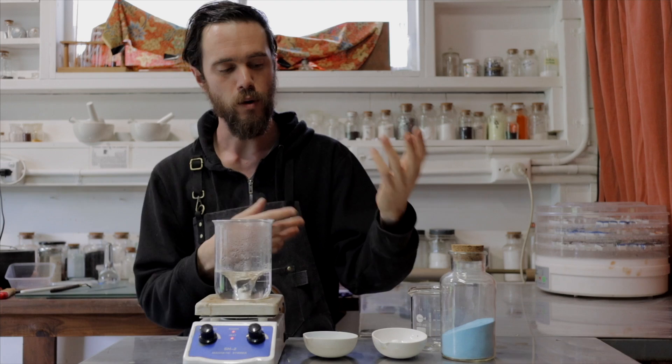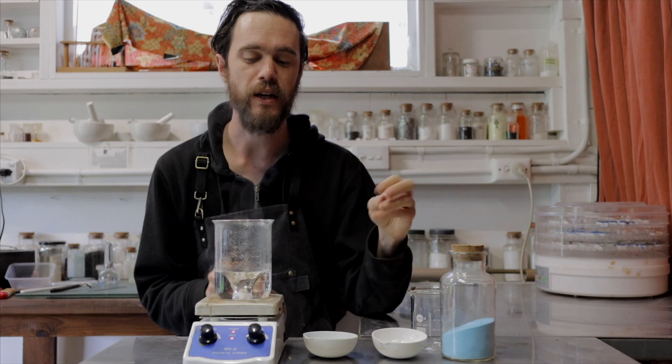Hello and welcome back to the Alchemical Arts. Today I'm going to be doing a shorter video than the last one, but it's going to be a continuation from the last one because we're still working with copper compounds. So instead of blue verditer, we're going to do green verditer this time, which is essentially synthetic malachite. If azurite is the blue copper carbonate in nature, malachite is the green version, and so what we're doing today is making the green variant of the copper carbonate. I'm yet to fully perfect this technique, but what I'm going to show you today is my method for making a fairly usable and serviceable green malachite-style pigment.